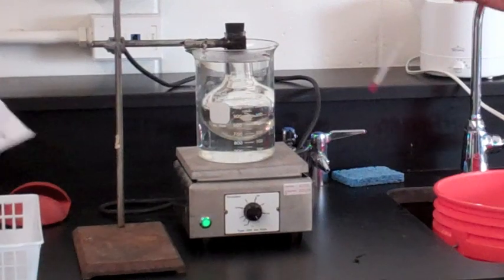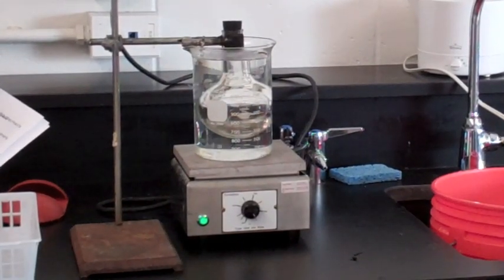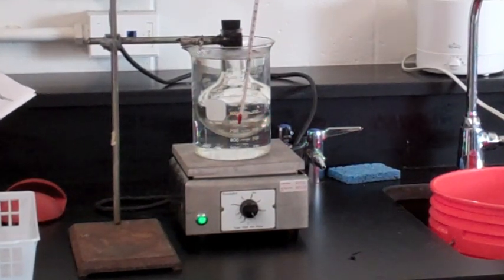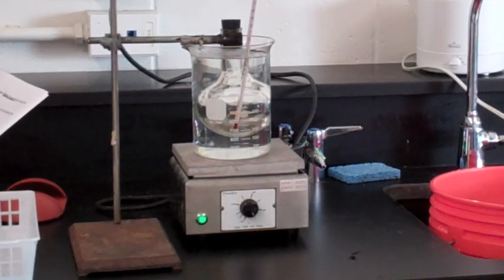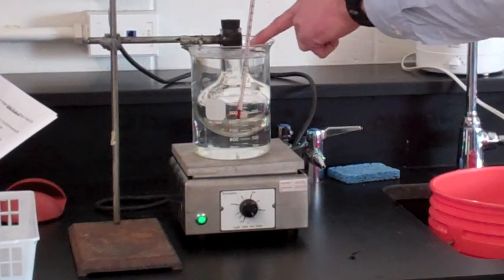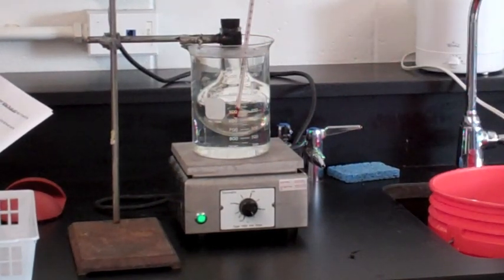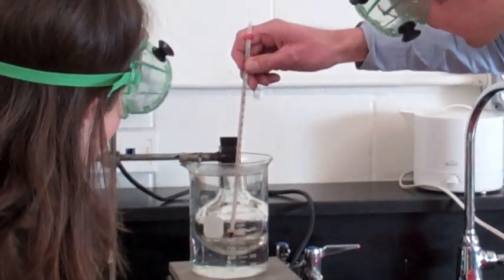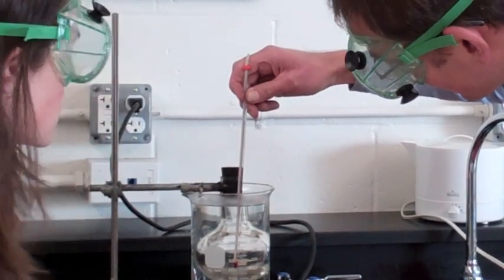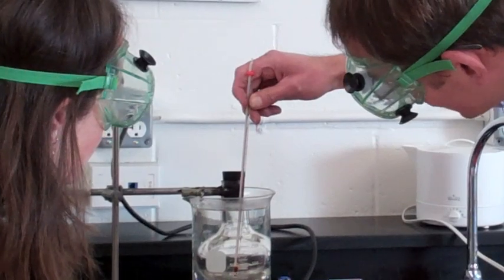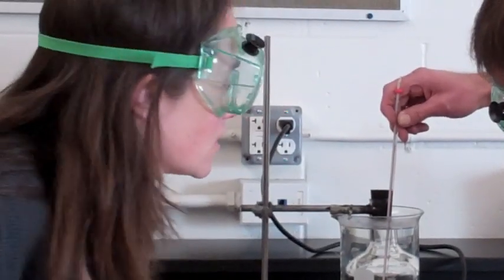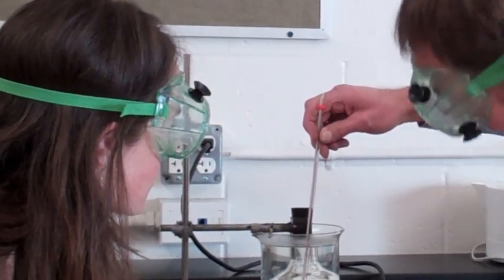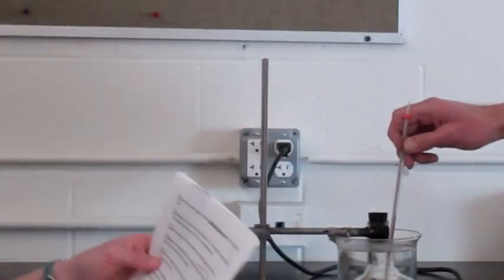Looks as though the water is boiling, and it's been boiling for nearly five minutes. Measure the temperature of the boiling water as close to the flask wall as you can. Be sure the thermometer does not touch the bottom of the beaker, because that would be too hot. We really want to know the temperature of the gas inside, and the easiest way to do that is to measure the temperature of the water near it. The alcohol in the thermometer is still moving, so we need to wait. Now it looks like it's leveled out at 98.5 degrees Celsius. I like the way you used your least count and your first best guess.